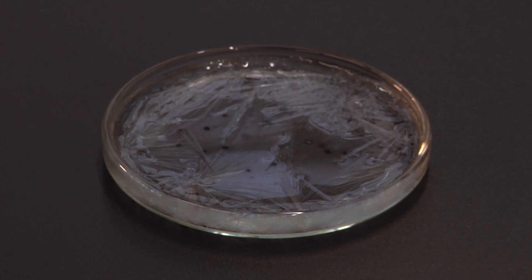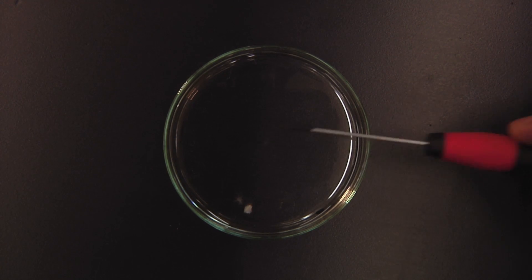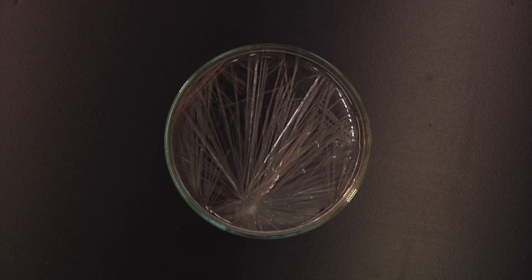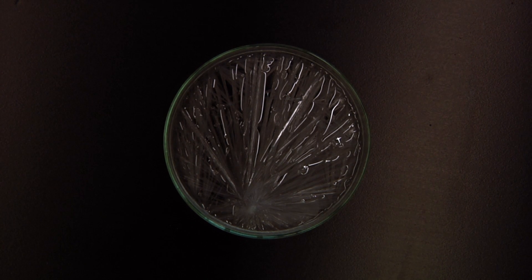The filaments of crystal are forming and giving off heat as they do so, thereby inhibiting their own growth, which is why it's so slow. We're struggling to make these go on cue. At least now we've got a nice black background so when it does work we'll actually see what's happening. I think why this is proving more problematic than before is that we're trying to do it in quite small dishes for the cameras, which are much more susceptible to evaporation. We'll concentrate on getting some nice shots of the crystallization process and then explain exactly what's going on.